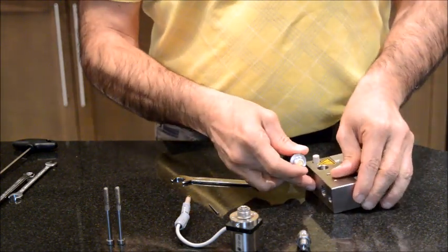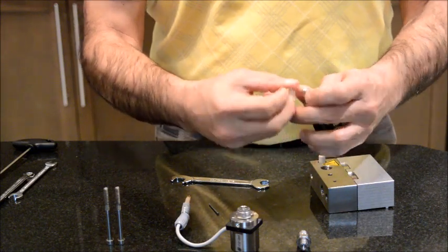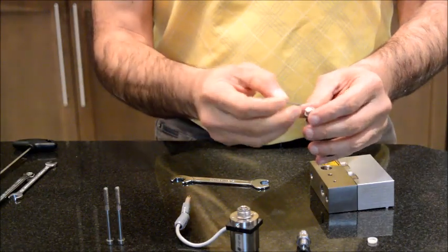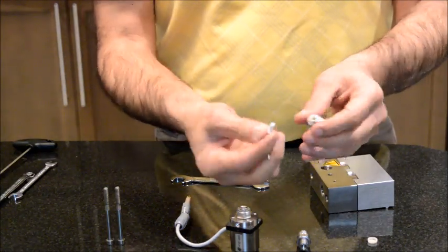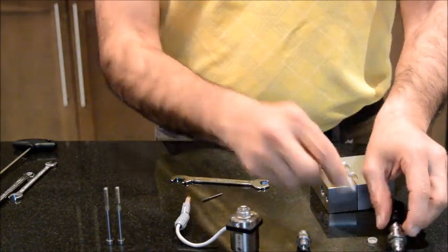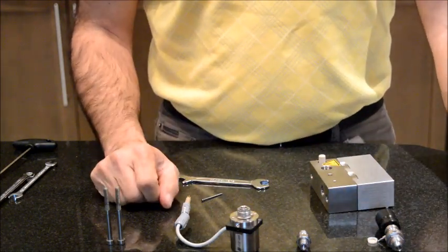We have a gold seal here. You remove the gold seal, and there is a filter inside. This filter is a consumable. This is relatively clean, but this is what you want to do. By replacing this filter, you will take care of your problem with the back pressure.